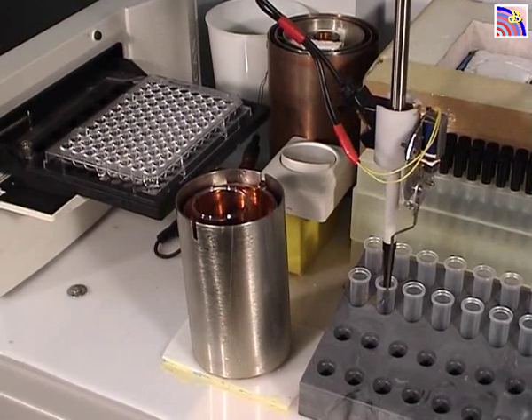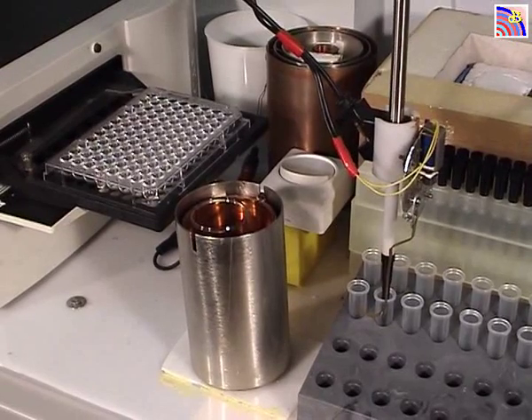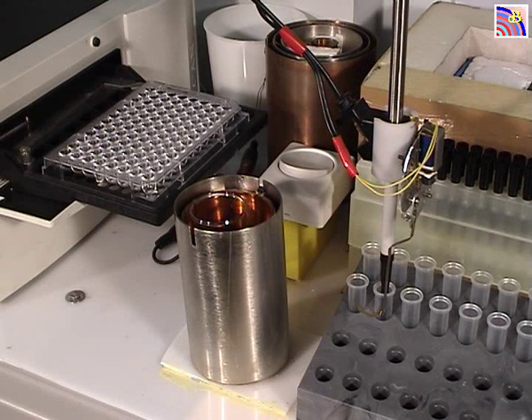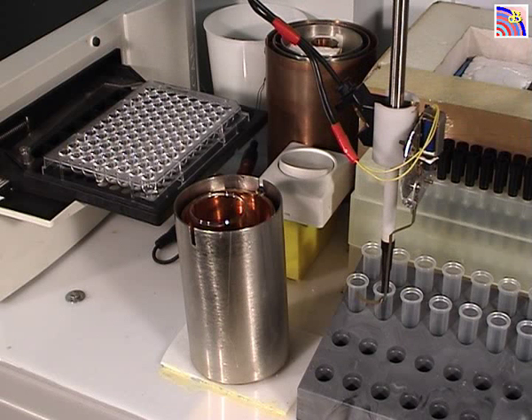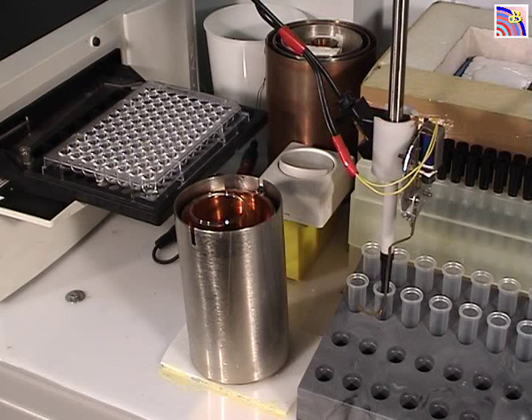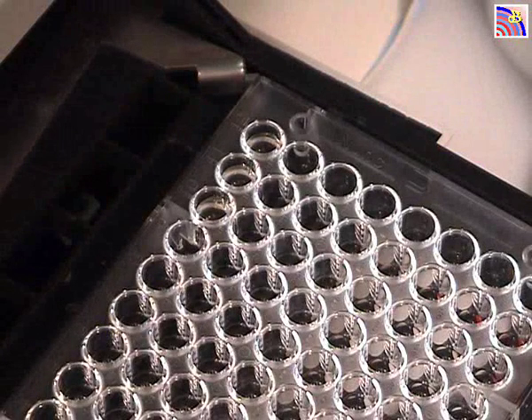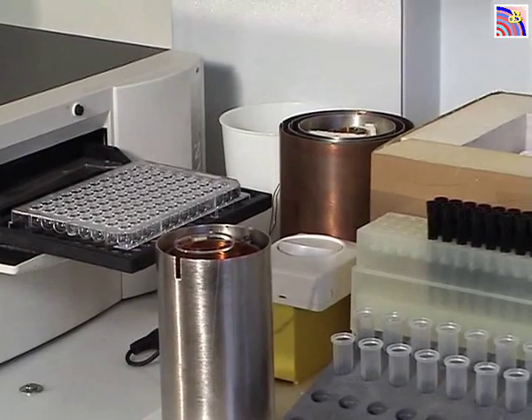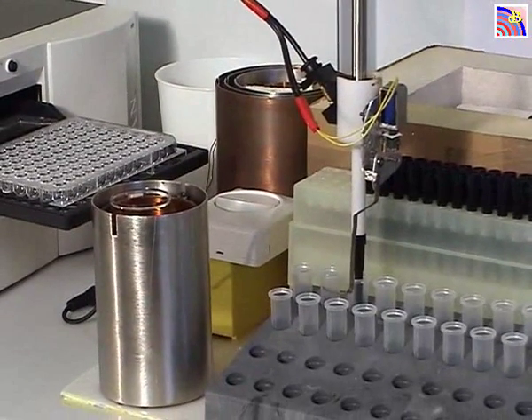So after the mixing, same thing for the second one, an aliquot will be delivered to the well. In fact, you can see the three first wells have been filled with some water, 160 microliters in each well. And same thing for the third one, mixing, okay.